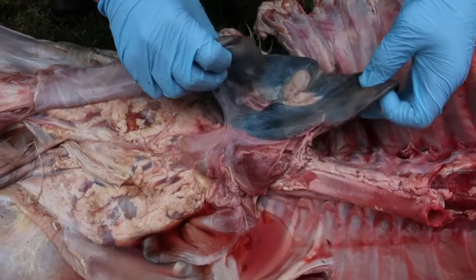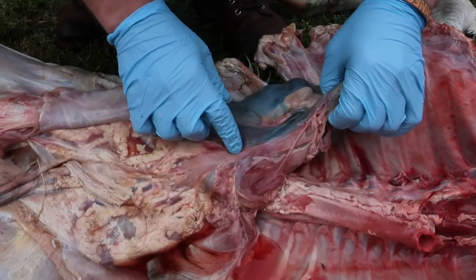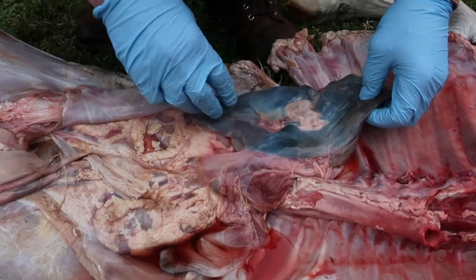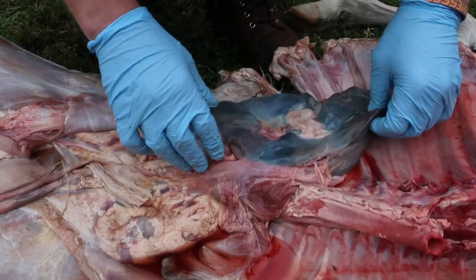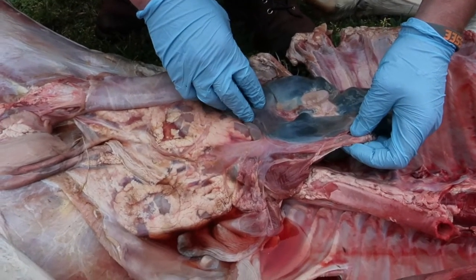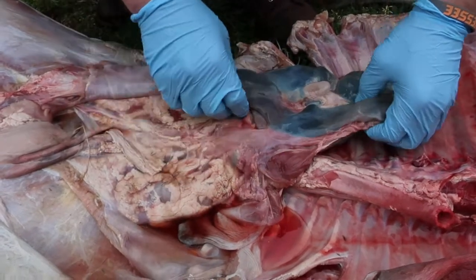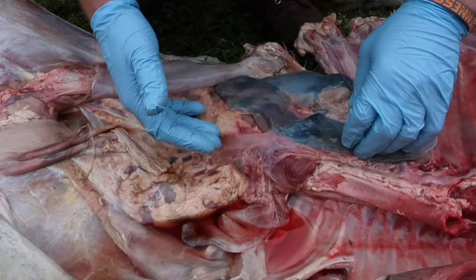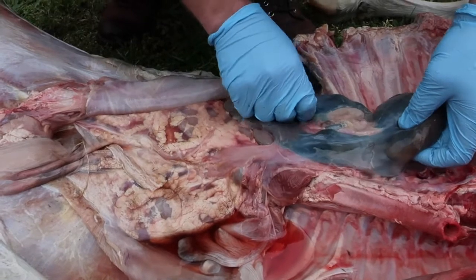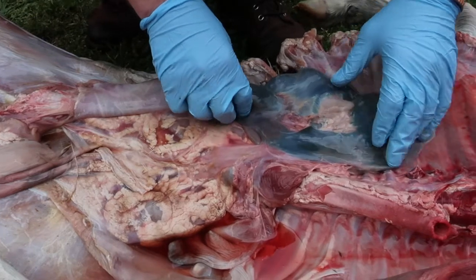Okay, so what I'm showing you, this is the liver right here, and underneath the liver is the beginning of the small intestine. As food exits the abomasum, it's going to enter into the small intestine. The small intestine has 3 major parts: the duodenum, jejunum, and the ileum. There will be absorption of different parts of the digestive material through the small intestine. That's its real function, absorption of really important things that are in that digestive material, such as amino acids and lipids and other important things, vitamins and minerals.